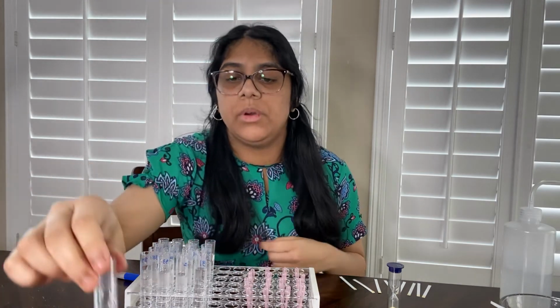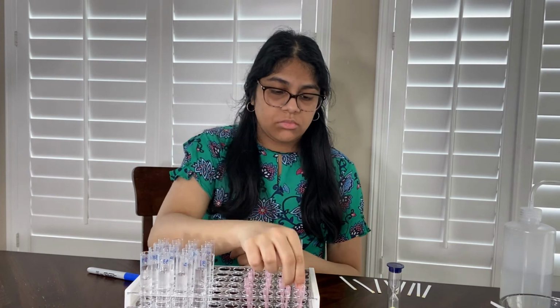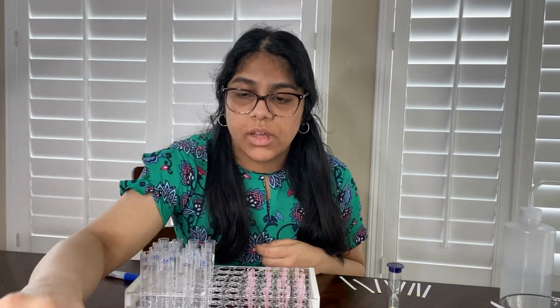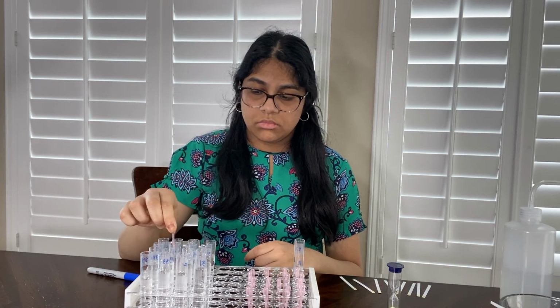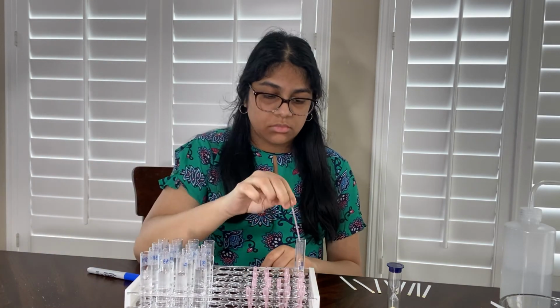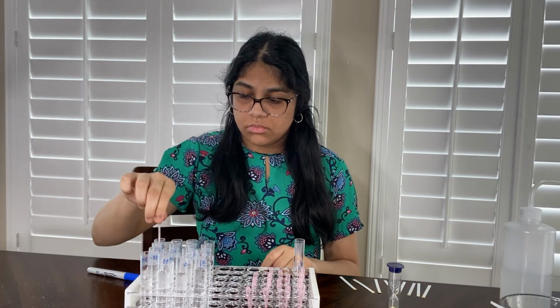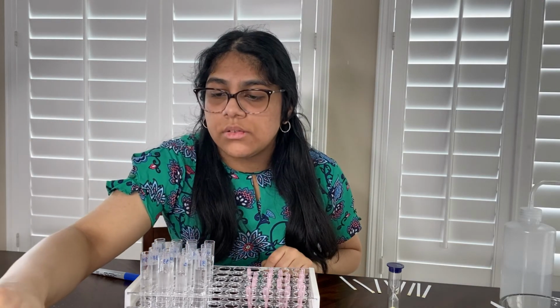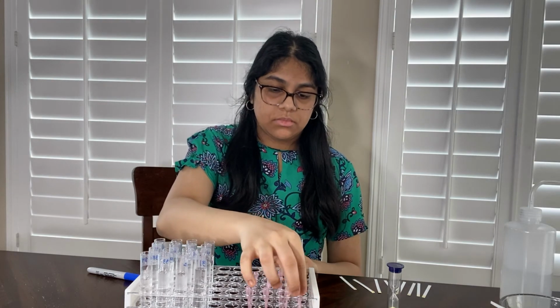All right, so that's row 1, and then same thing, but with the other rows. Okay, so now same procedure, but now I'm just going to finish all of the 4 columns.